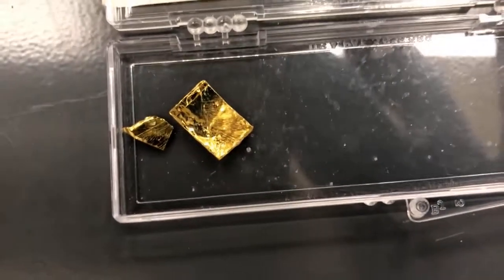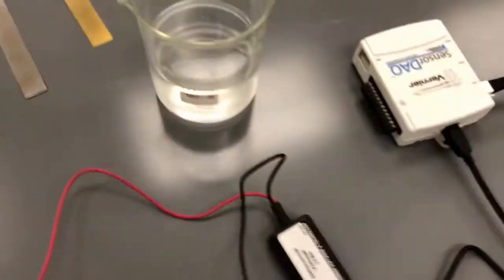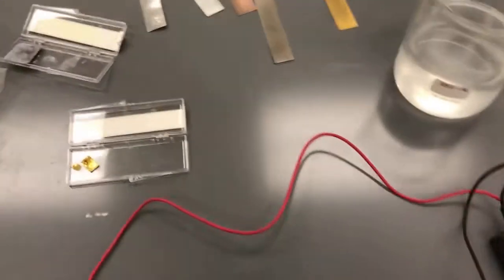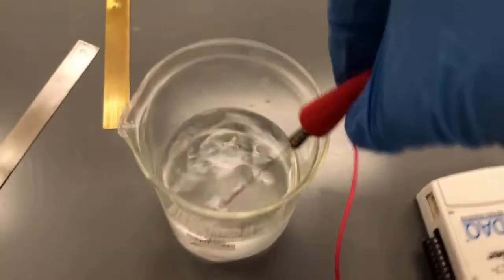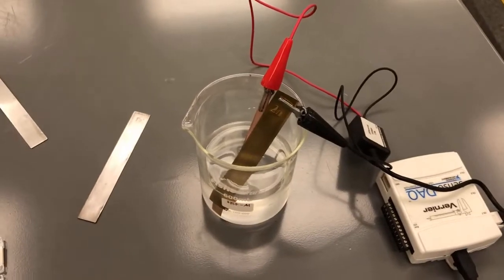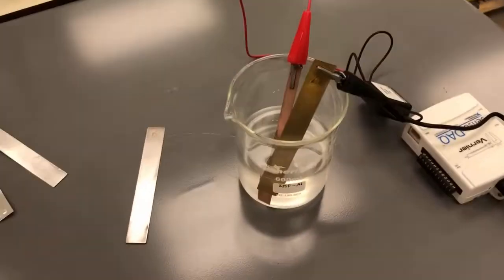on the other hand, seems surprisingly fine. We're going to create a cell. We said in the lab handout that copper is going to be our cathode - cathode is red right here. Clamp it up, put it in the solution. Then we'll take our other materials - let's do brass for example - clip it, and measure the voltage. You're going to plug this into a computer, measure it, and spit out the data file.